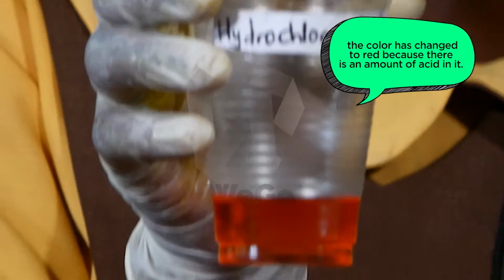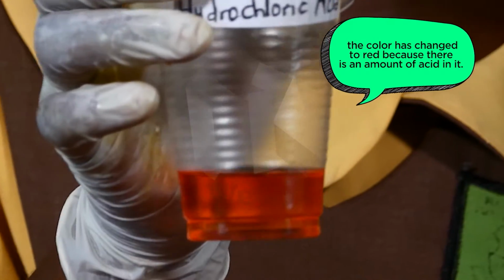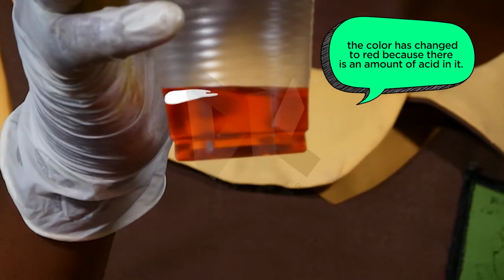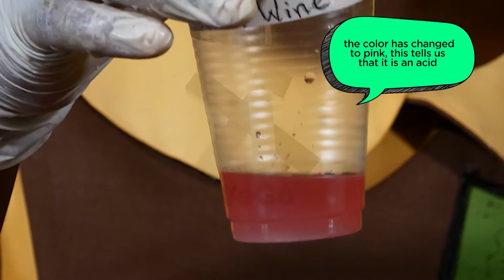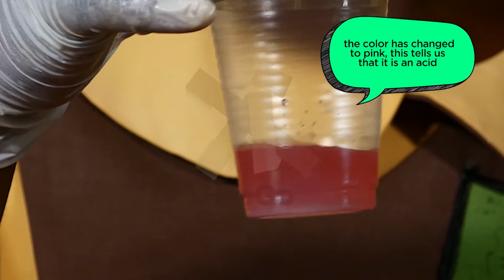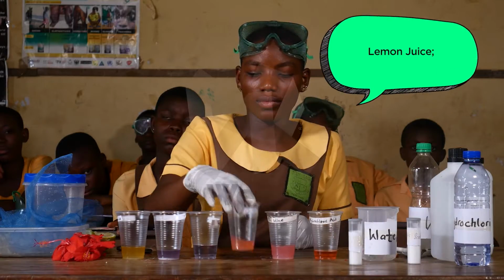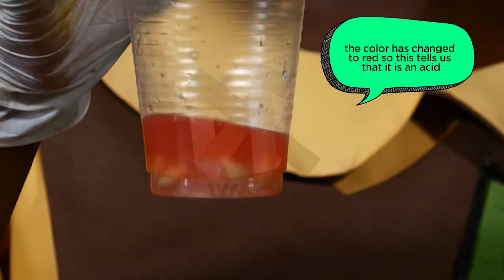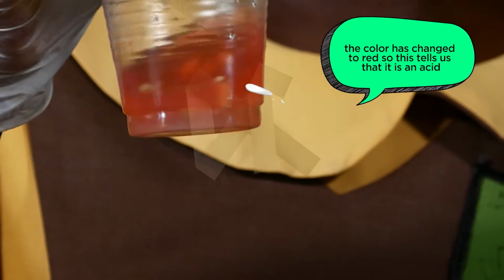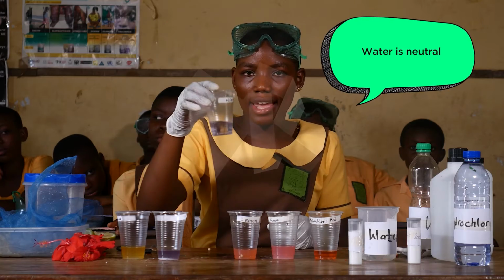Hydrochloric acid. The color has changed to red because there is an amount of acid in it. Palm wine. The color has changed to pink. This tells us that it is an acid. Lemon juice. The color has changed to red. So this tells us that it is an acid. Water is neutral.